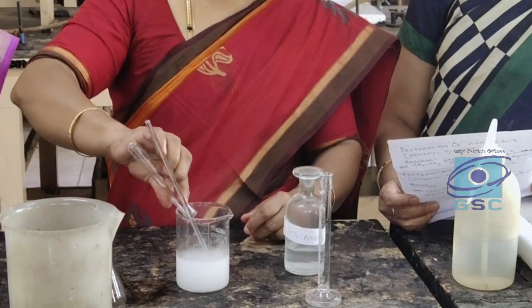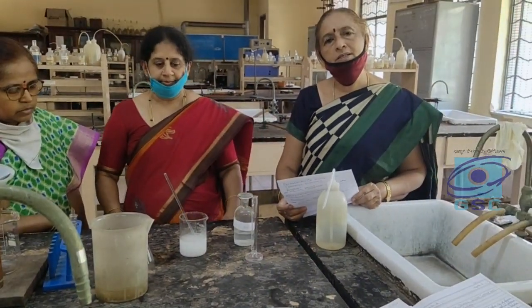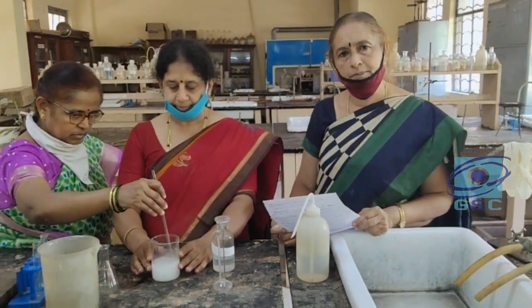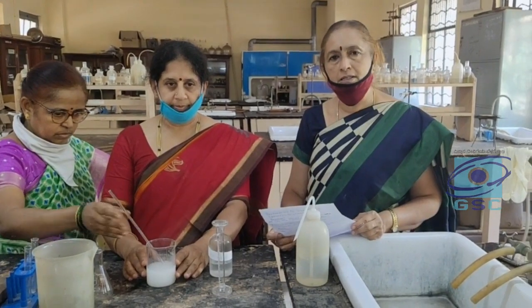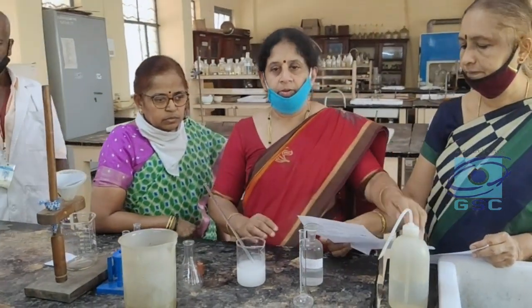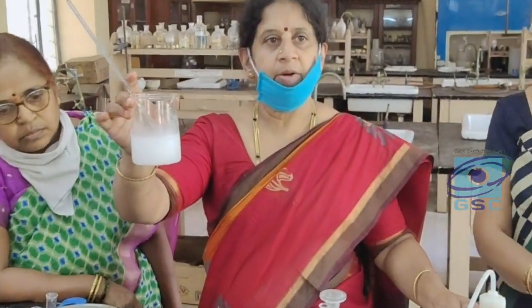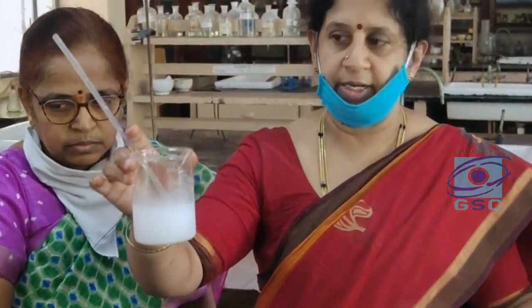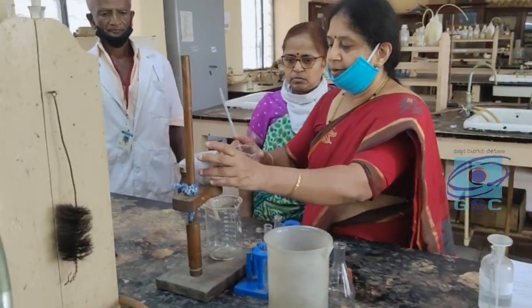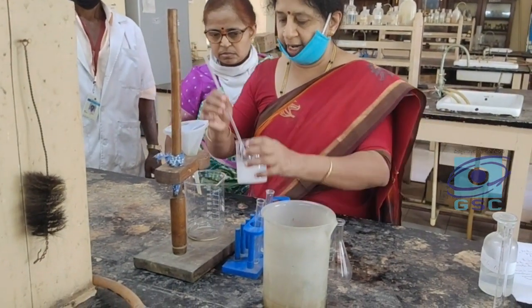Once the preparation is done, students should calculate how much product is obtained and how to calculate the percentage yield — my colleague is going to explain to you. Once the solid is separated, we are going to get it by filtration. We are going to filter it and the residue what you get is hippuric acid.